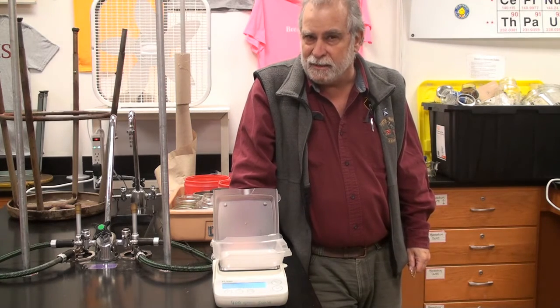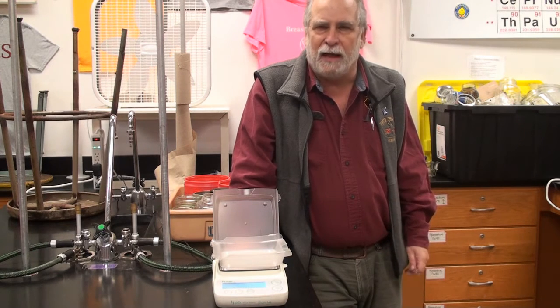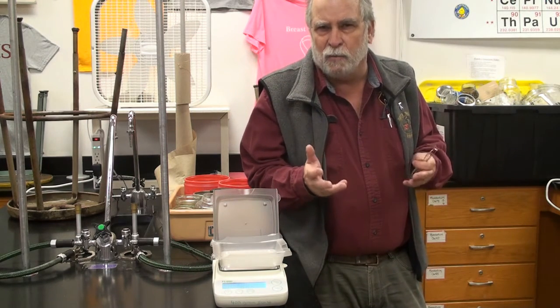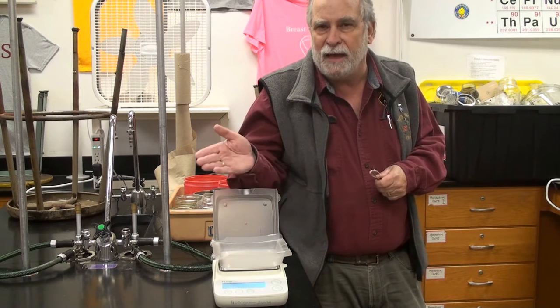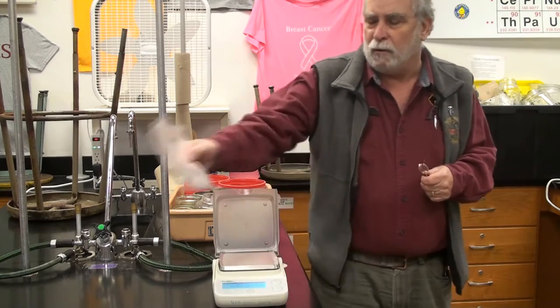Today's lab assignment is one where we're going to count particles by their average mass. In a way, this is what's done when we use the periodic table to count atoms, when we use the mole concept. The idea is that we take a large group of atoms and find their average mass. And once we know the average mass of a large group, we can use that to determine by mass how many atoms we have in a smaller sample. We'll do that using our own averages for some other particles today.